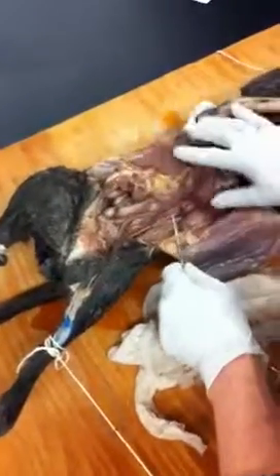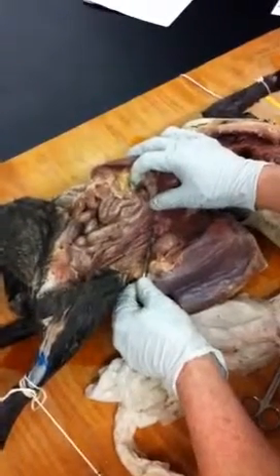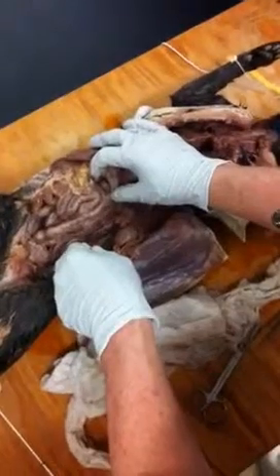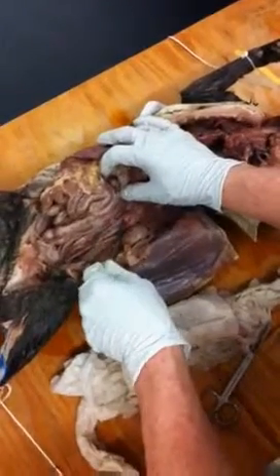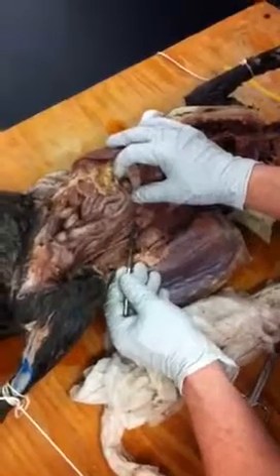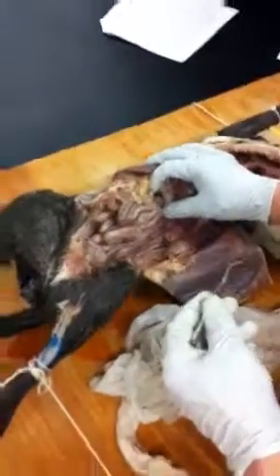The other parts that we have on our list that have to do with the kidney are the renal vein, which is the blue structure here, and the renal artery, which is just above it, the red structure right there. The renal artery is somewhat smaller than this, mainly because of the laxity and thinness of the walls during the injection. So the renal artery here, the red one, renal vein just below. Can't miss it, okay? This is where red and blue do help.